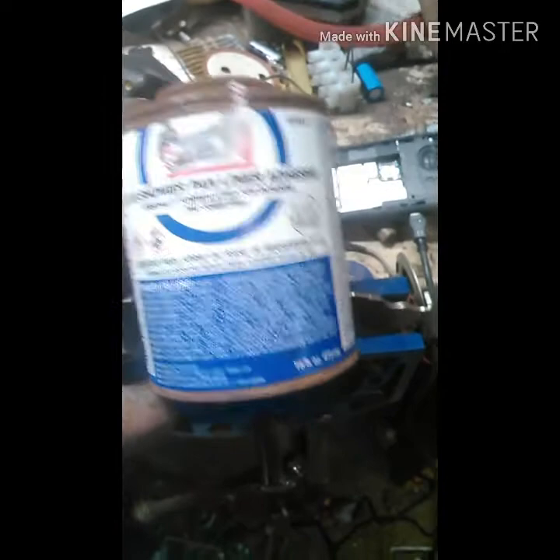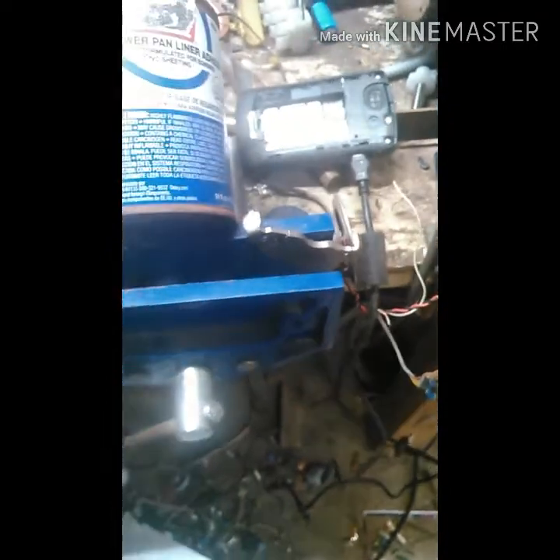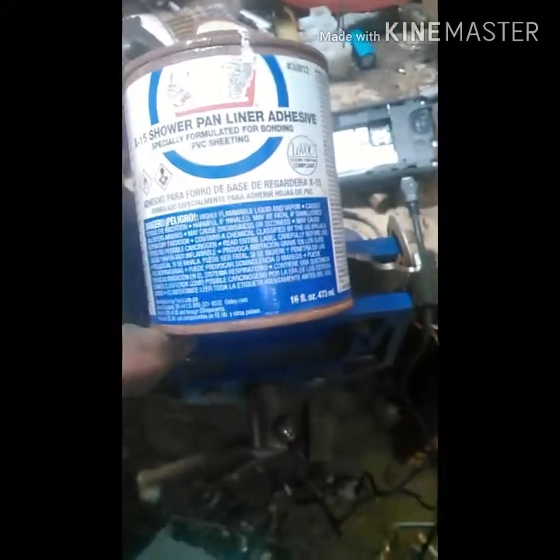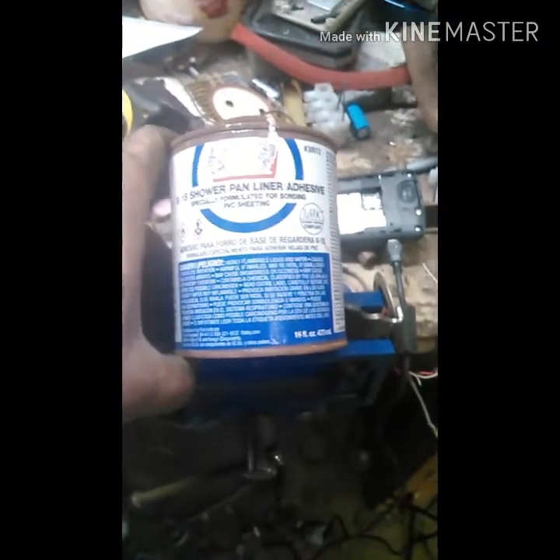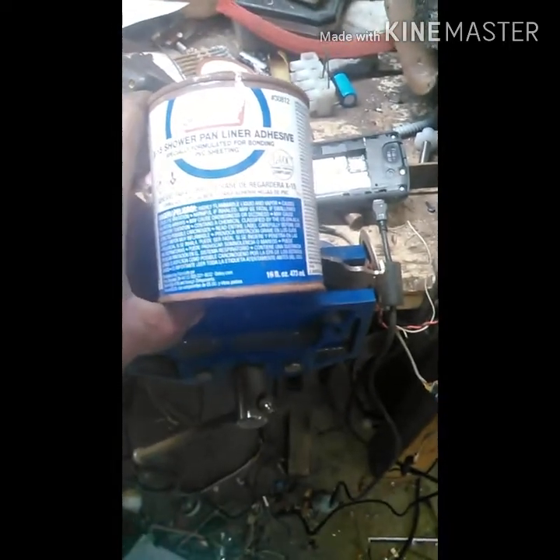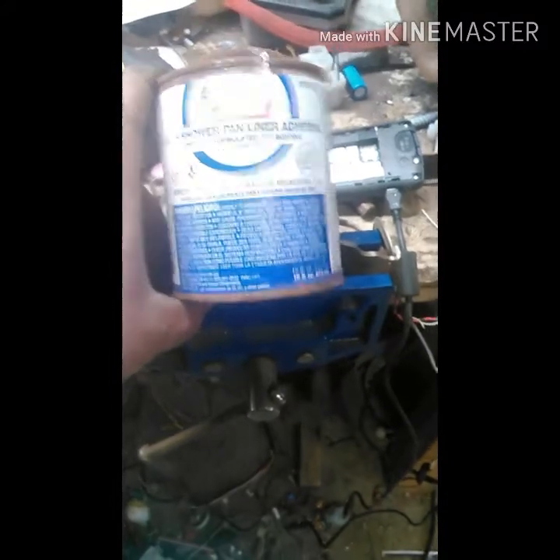That's basically everything that's in this, and there's also polyvinyl chloride I believe. I took this, put it in my distillation apparatus and distilled it. Now I'll show you where I'm at — I've got it in my boiling flask and I've got it under max vacuum which is minus 28.